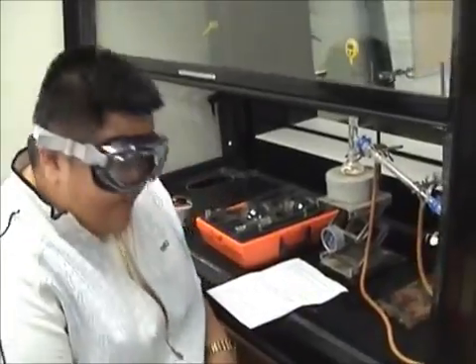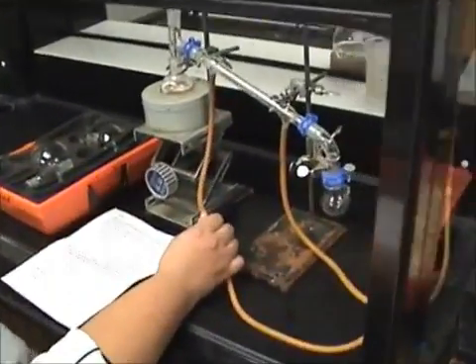Now, we are ready to begin our simple distillation. Turn on the water supply and the heating mechanism. Make sure the tubes are not bent or pressure will build up.